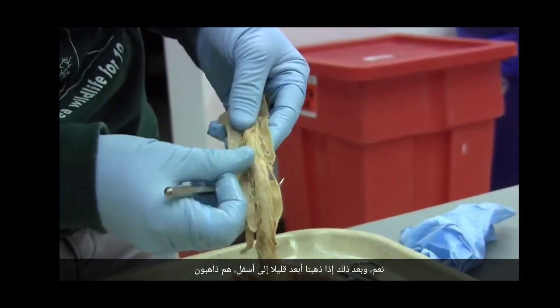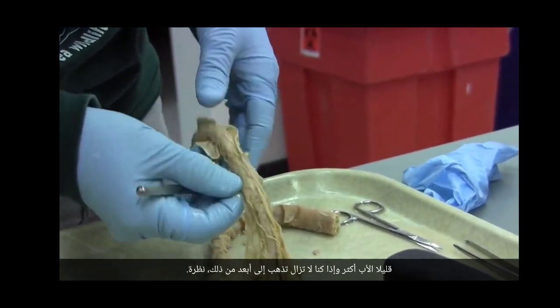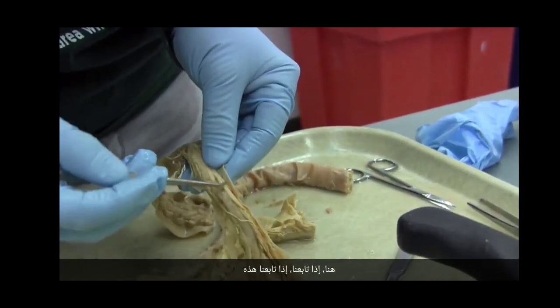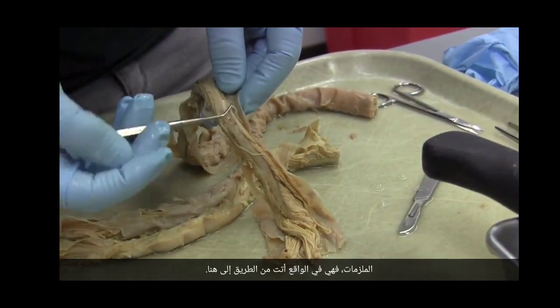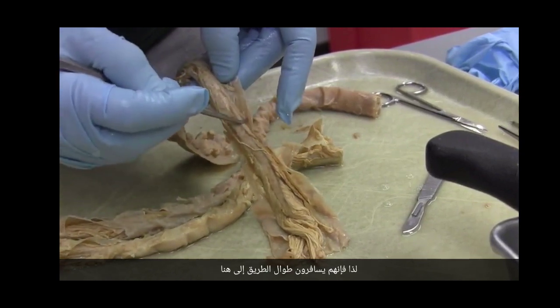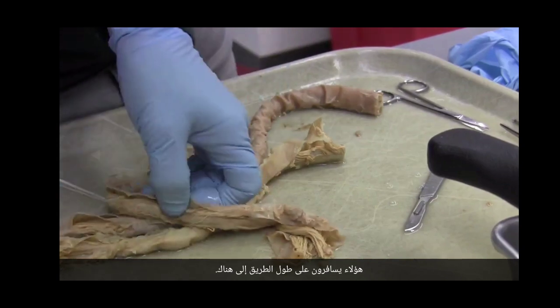And then if we go a little bit farther down, they're going a little bit farther more. And if we still go down farther, look, here, if we follow these fascicles, they actually came from way up here. So they're traveling all the way down here. These are traveling all the way down there.